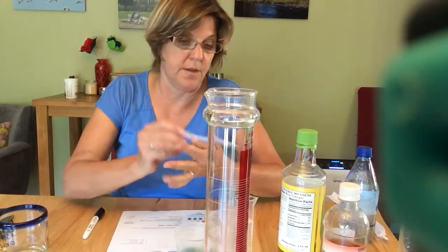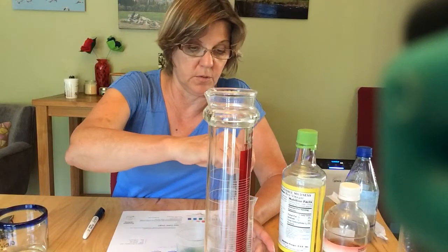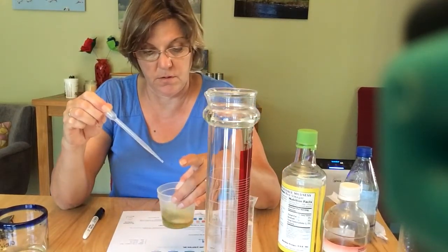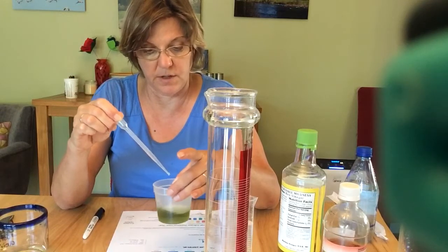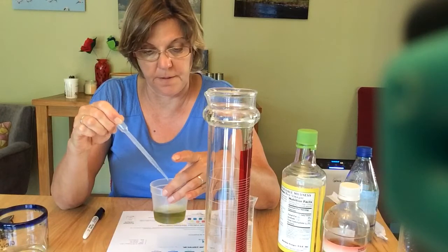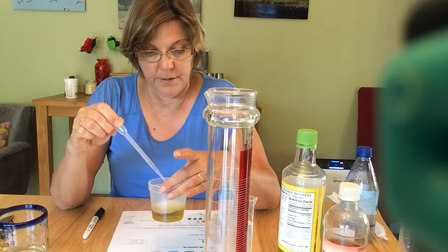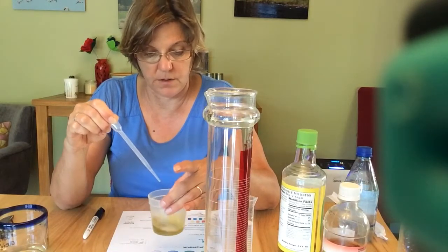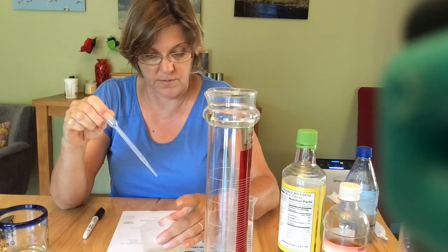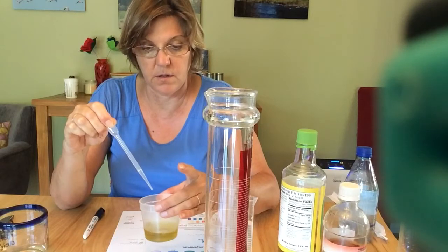Now I'm going to add a little bit more, a couple more drops, and see if I can get to 6. I'm going to have to add a little bit more. Whoa, almost at 5. Another drop.